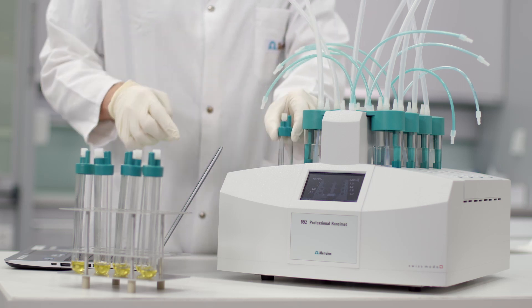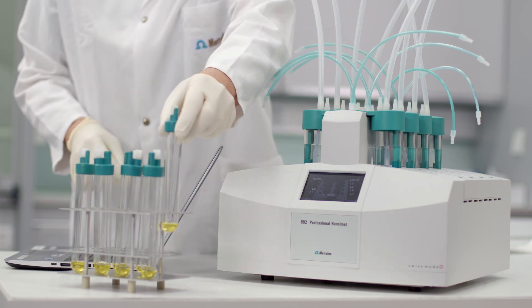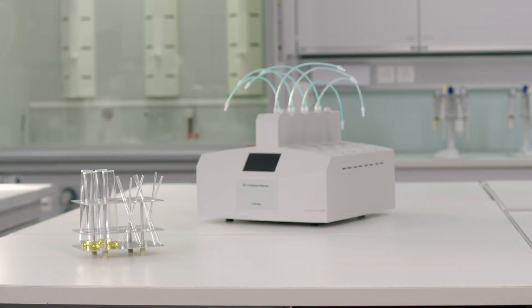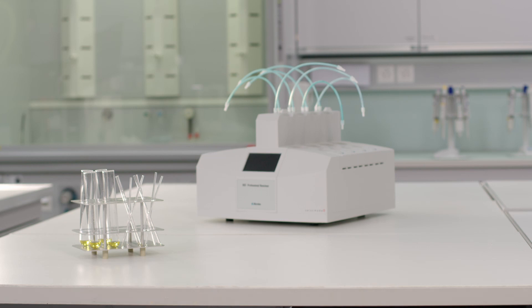After the measurement, clean the reusable parts. The reaction vessel and the air inlet tube are single use parts. All other parts are cleaned in a dishwasher and then dried in a drying oven.